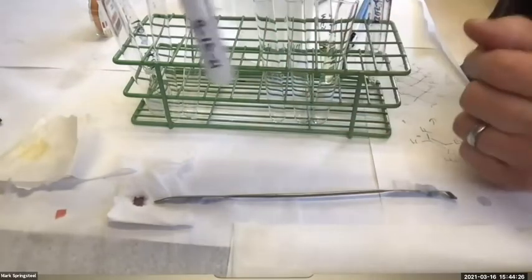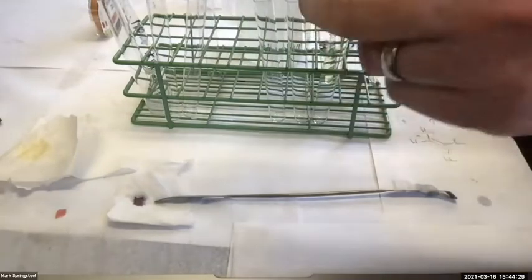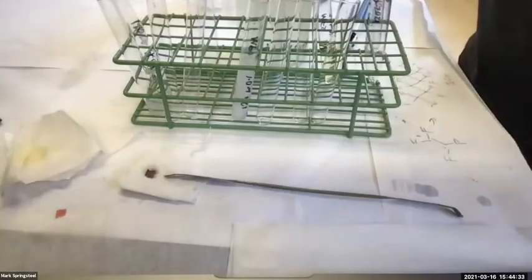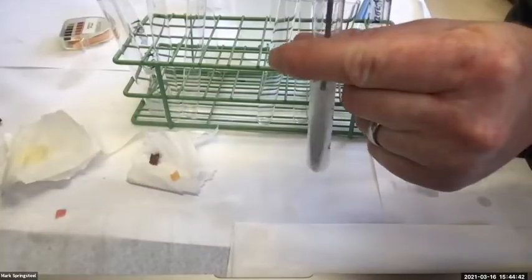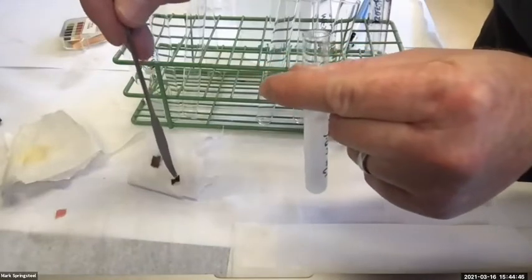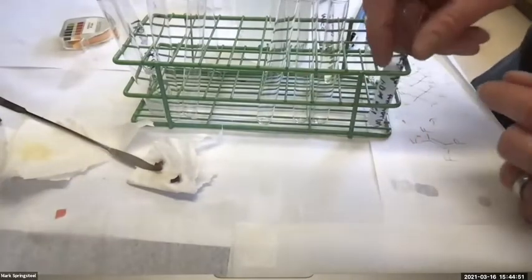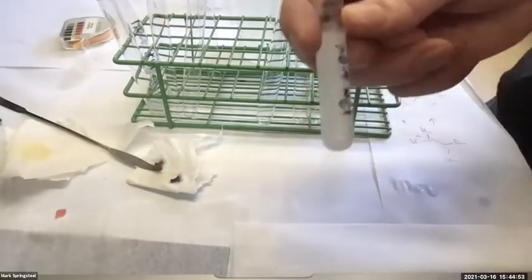Yeah, no, I guess that's good. Okay, so this will be our first precipitate. Oh, I'll check the pH again, see if that made a different color. Yeah, that's a little darker. Okay, yeah, I think that was probably a good choice. All right, so that's our first precipitated aqueous layer.